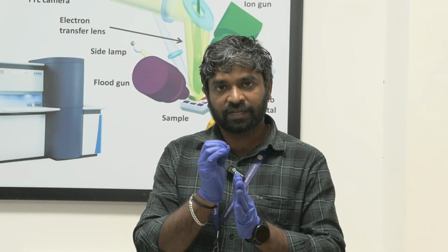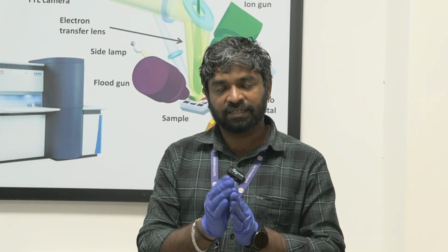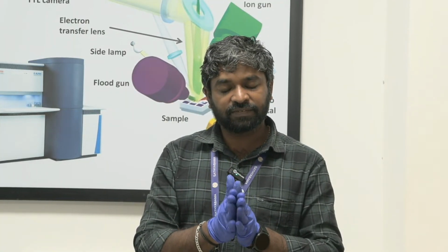When you check the binding energy scale, one position corresponds to titanium in the zero oxidation state. If the titanium reacts with oxygen, it will form titanium oxide, and its binding energy will shift either higher or lower. Like that, when metals become any compound, their binding energy will be different. So binding energy is the fingerprint which gives the chemical composition of the materials.